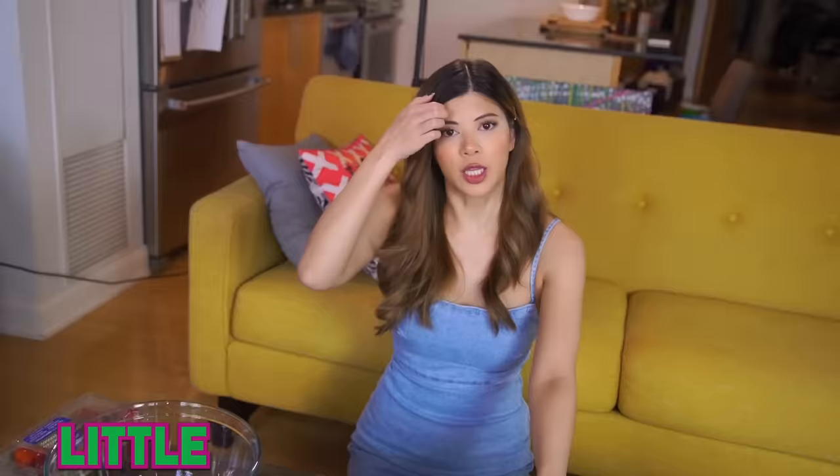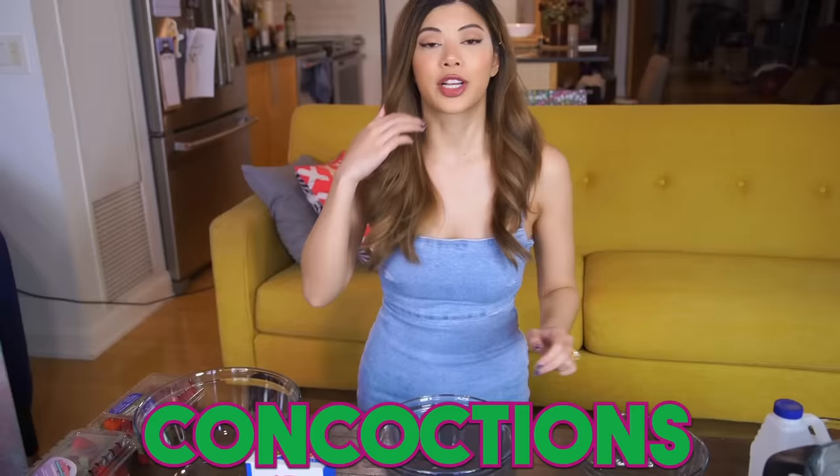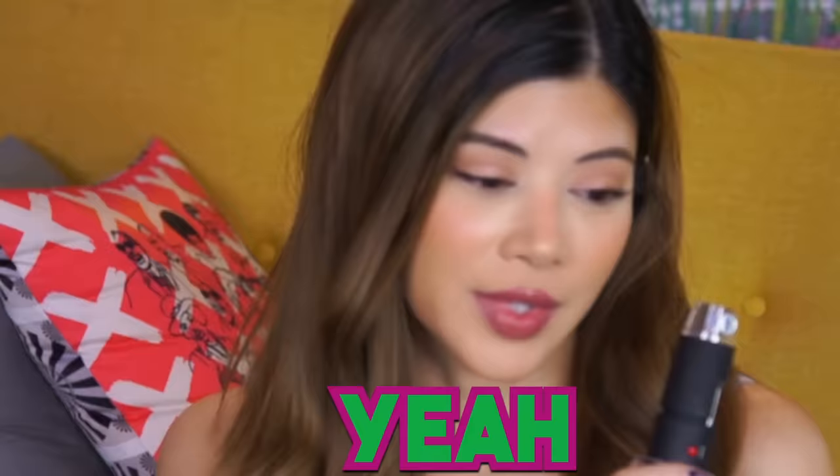Hi, I'm Kartha Giewert coming at you with some salt and a microscope. Do you know why? It's because I don't believe it — I don't believe that there are little bugs in strawberries and that if I eat them without washing them I'm getting extra protein. I don't believe it. So what are you gonna do about it?